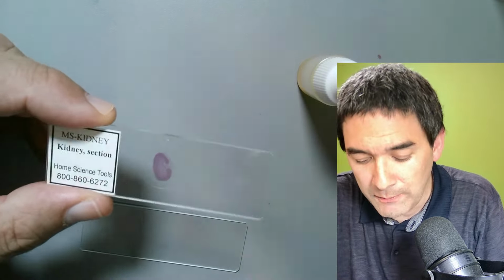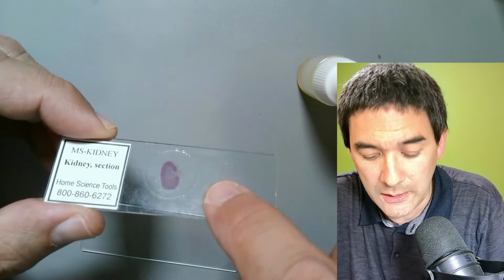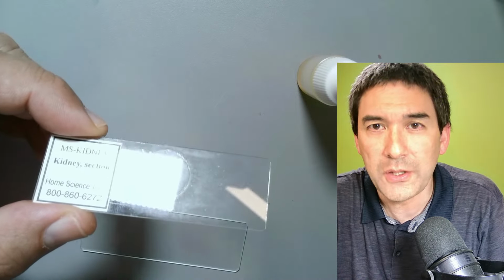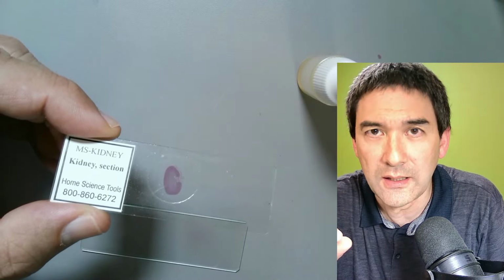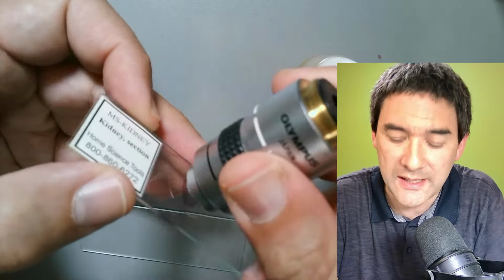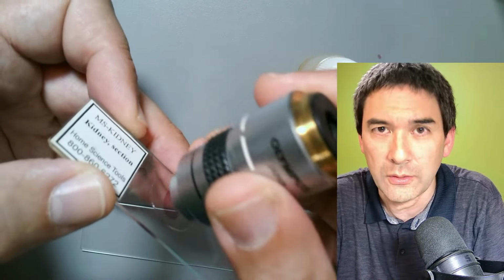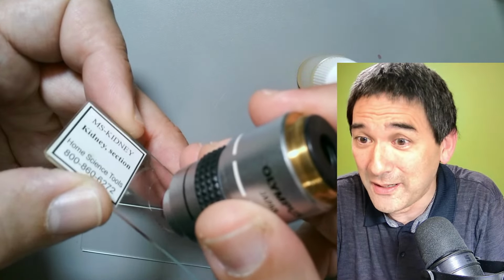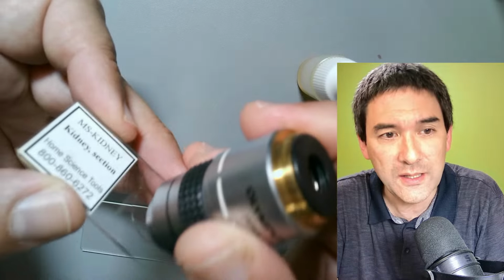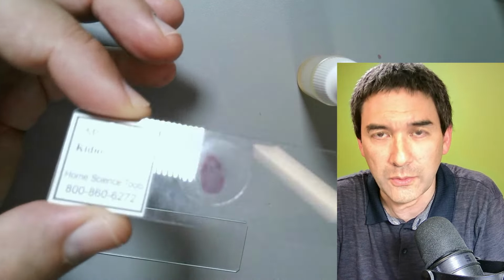And reason number three, some permanent slides are actually quite thick. That's also not good, because the distance between the objective and the cover glass is so small, if the slide is too thick, then you're going to crash into the cover glass. So this is why I'm saying don't even use it on permanent slides.